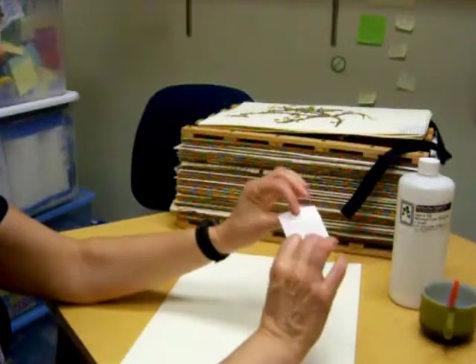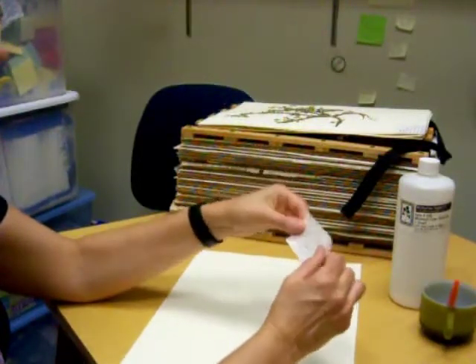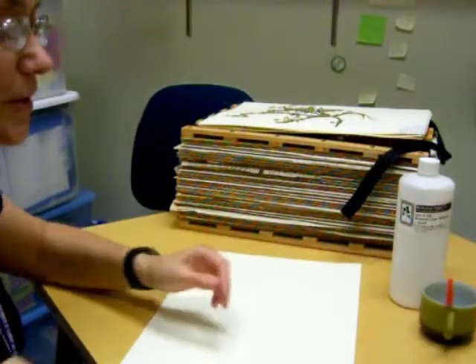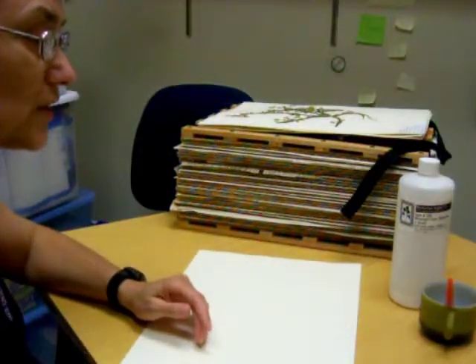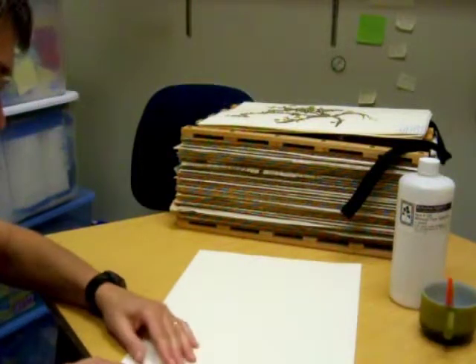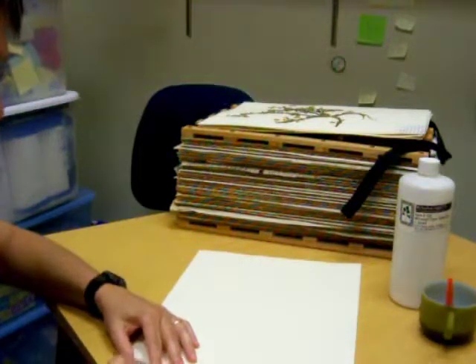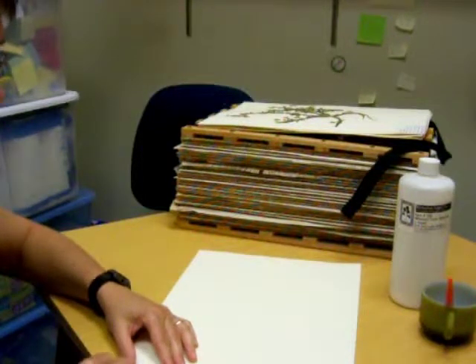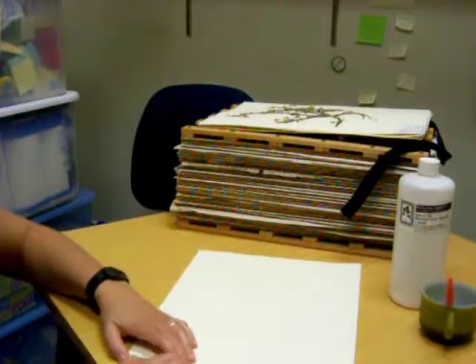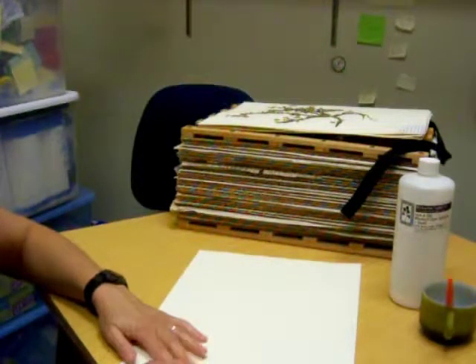Then I would take the label, which does not have any glue on the back of it, and put it over on the plastic sheet that has all the glue on it and affix it down here. You can write on it before or after, but I would suggest writing on it before — at least the species name — so that you know what you have.